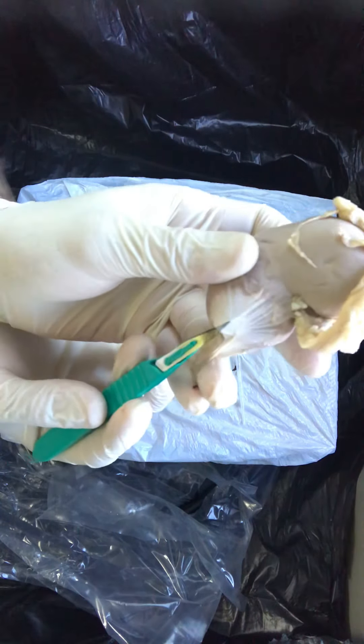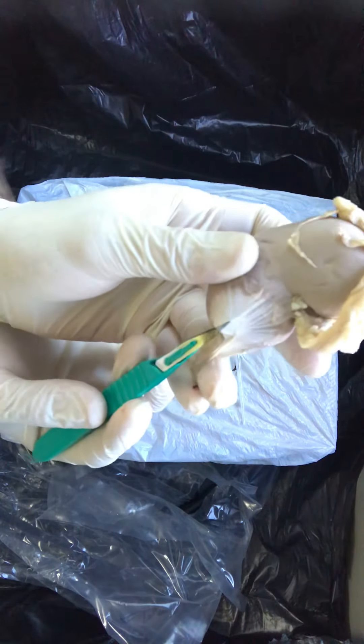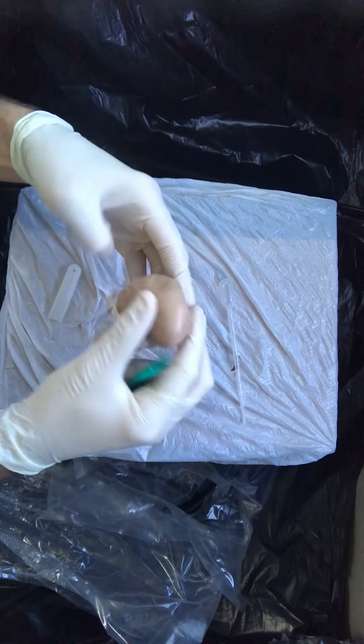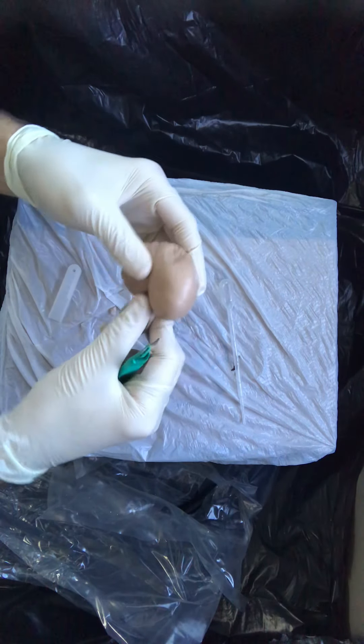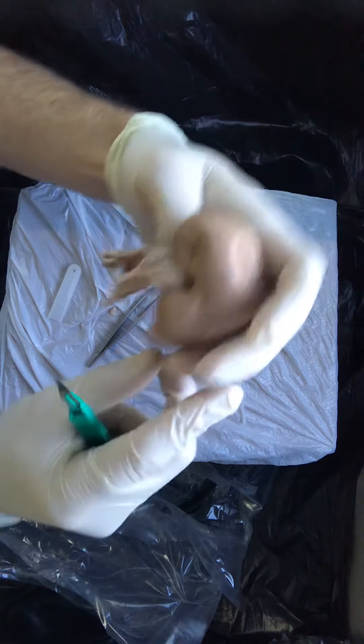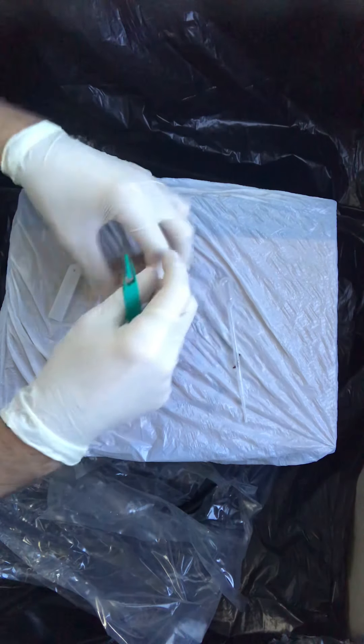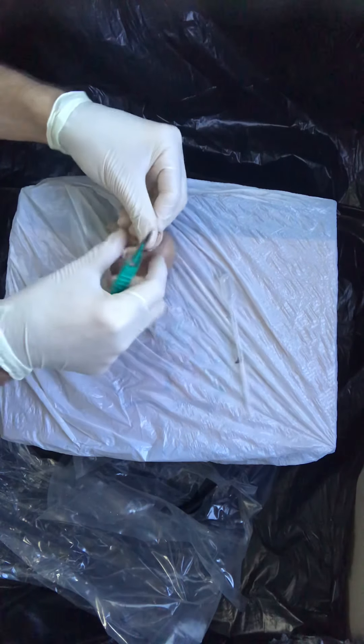It's a little easier to separate than the pericardium that we've held and touched before, or the dura mater of the brain, but really this can be removed. As you saw me do there, kind of trimmed away.